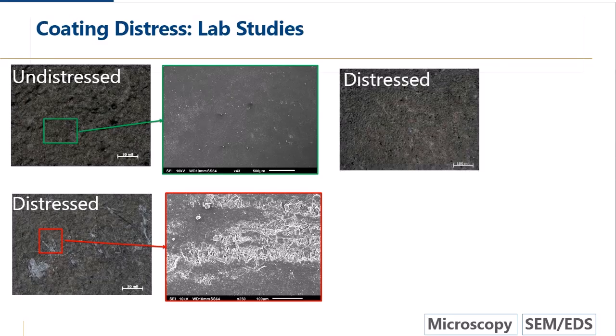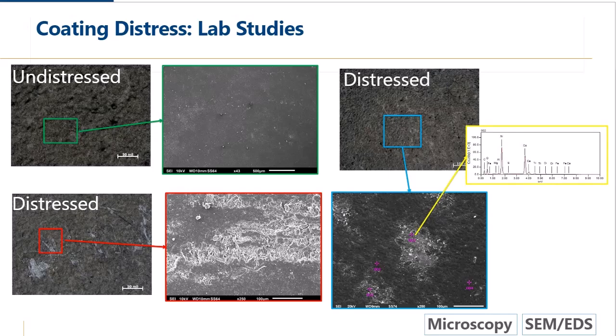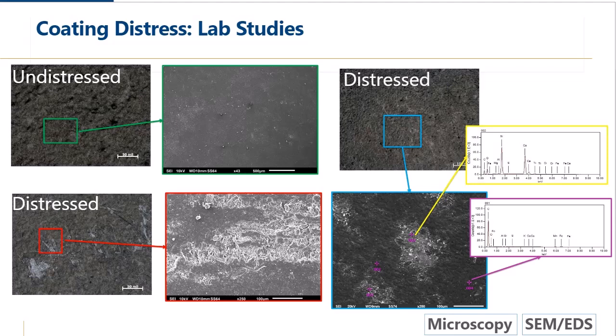And then we had a couple different types of distress. So we look at this other distress, which isn't so scratchy looking. It's a little harder to see. But we will look at that area in the SEM. We see sort of just these blotches of different kinds of material that looks a little different compared to the more surrounding darker colored material. And when we look at them, we use the EDS to look at the elemental analysis. If we look at that circular patch in the center, the EDS tells us we've got a lot of silicon and calcium and oxygen and other elements that are very consistent with a fiber cement panel. So this is what we expect to see. And then we look at the more uniform area and we see a lot of carbon. We don't see a lot of other stuff.